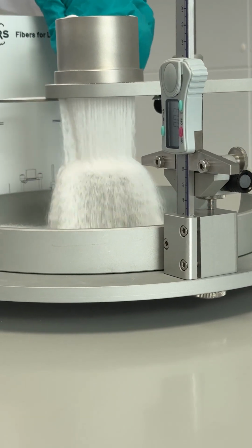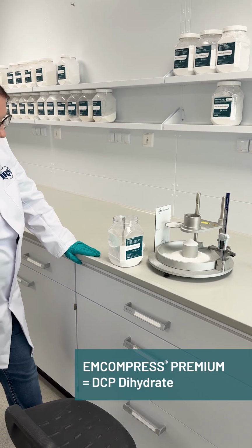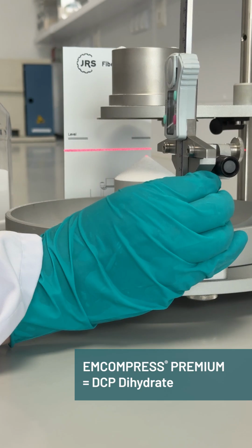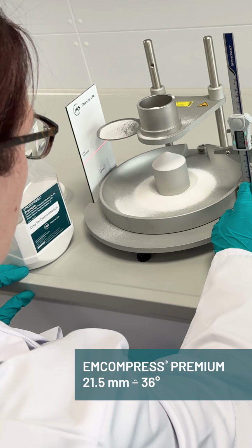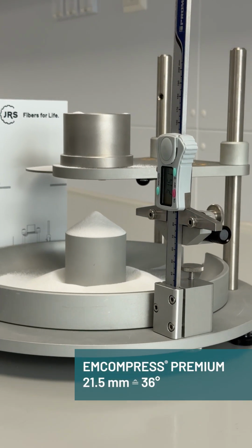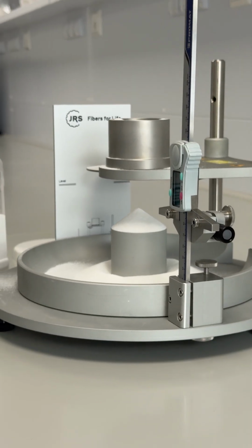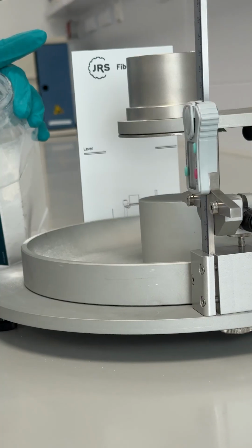So now I'm going to let it flow. And you can see a nice cone with this well-flowing material. And then I simply measure how tall the cone is, 21.5 millimeters. So now we can calculate the angle. You can imagine that water flowing very well will be flat, and materials that flow more poorly will be more pointed. So this angle can be correlated to flowability.